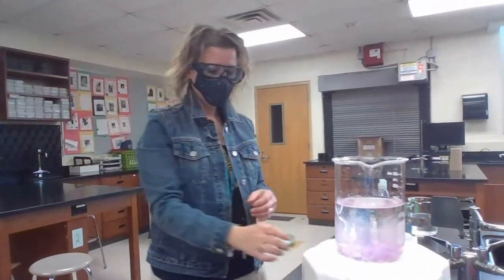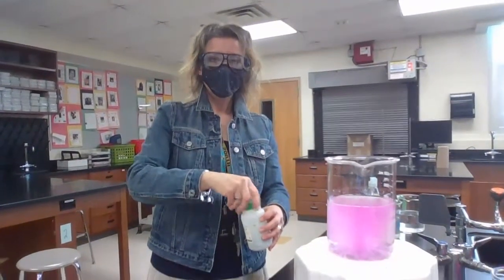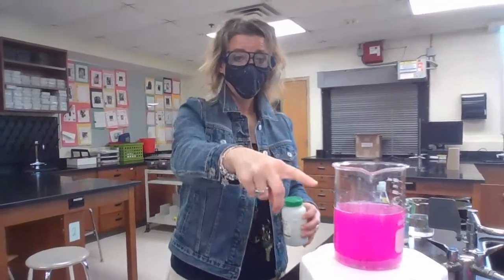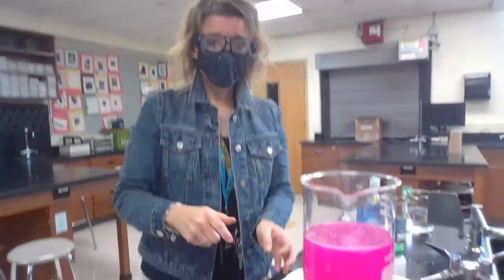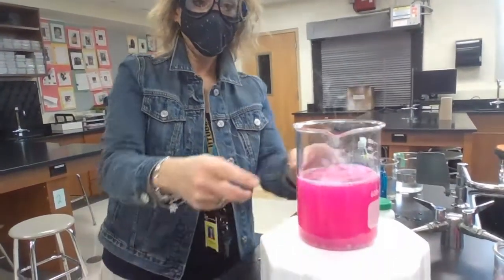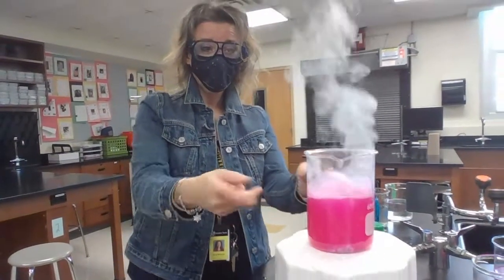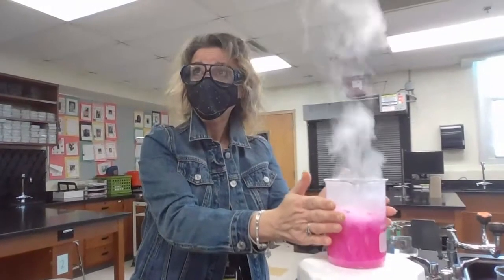All right, so one thing you should notice right away is, did all the other ones sink or float? Oh, yeah, they floated. And now this is sinking. Whoa, look at that. That changed colors right away, and you guys might be able to see down a little bit. Bubbles. See all those bubbles? So it's bubbling like crazy. It sure is. And wow, it's warm.